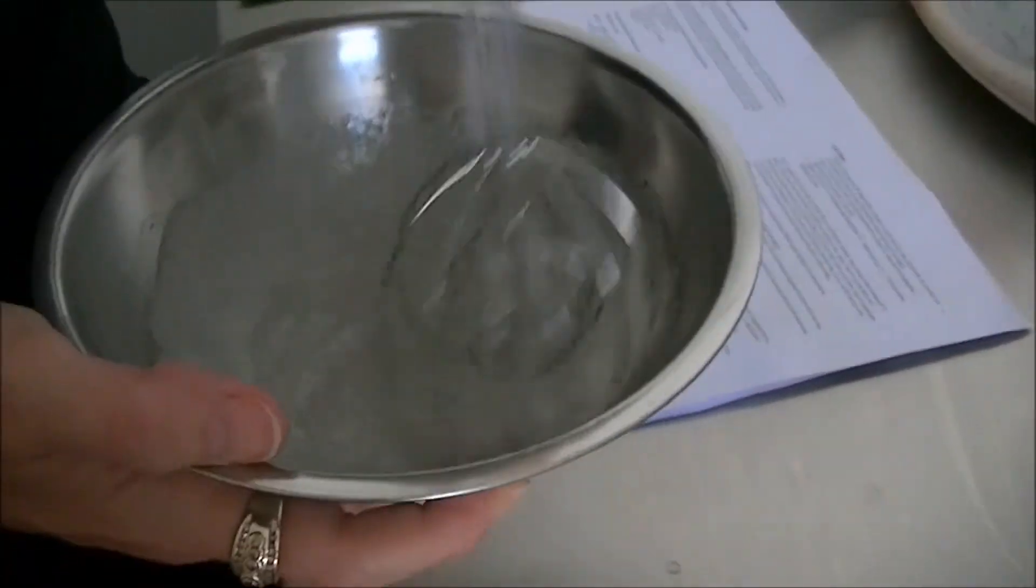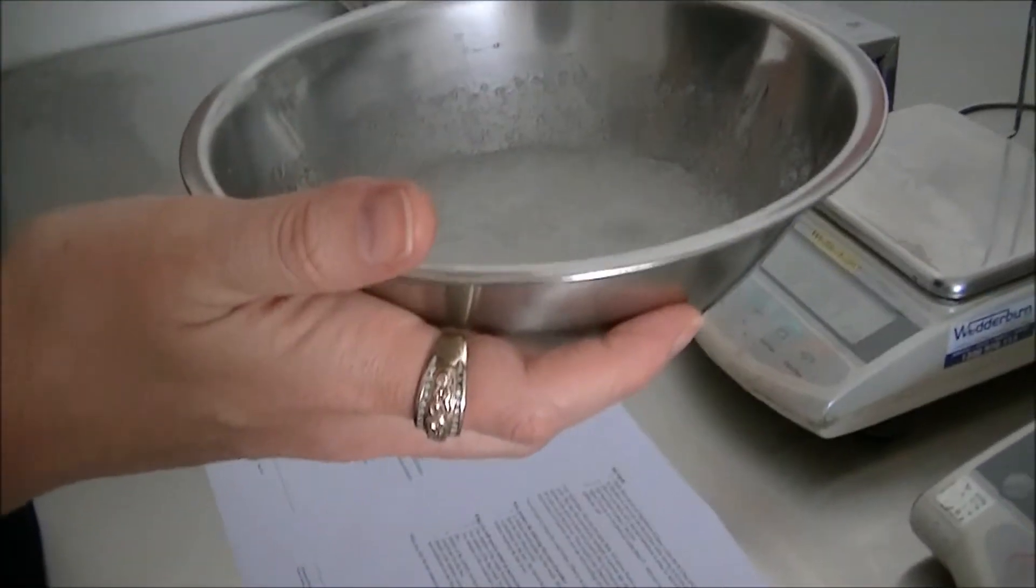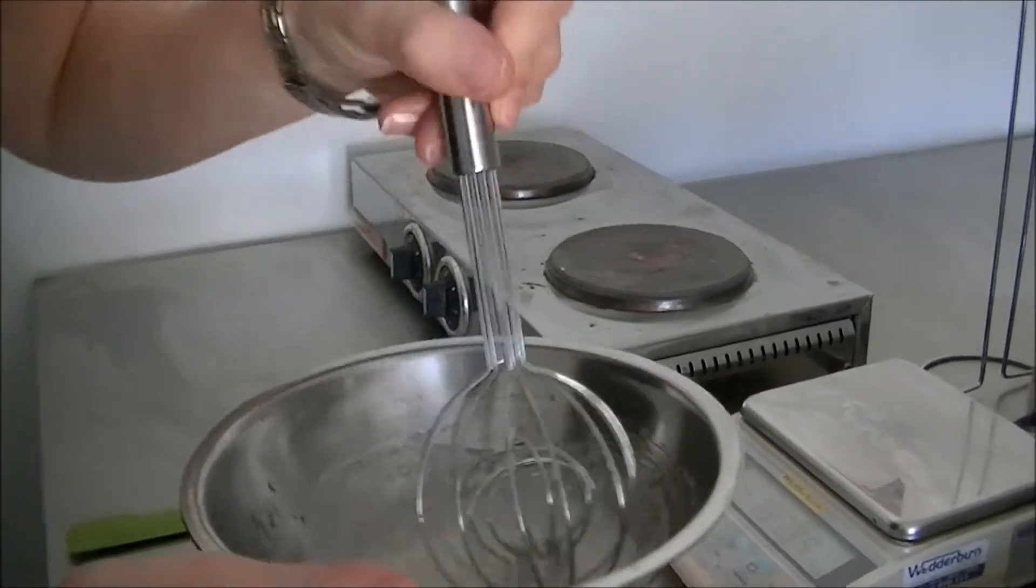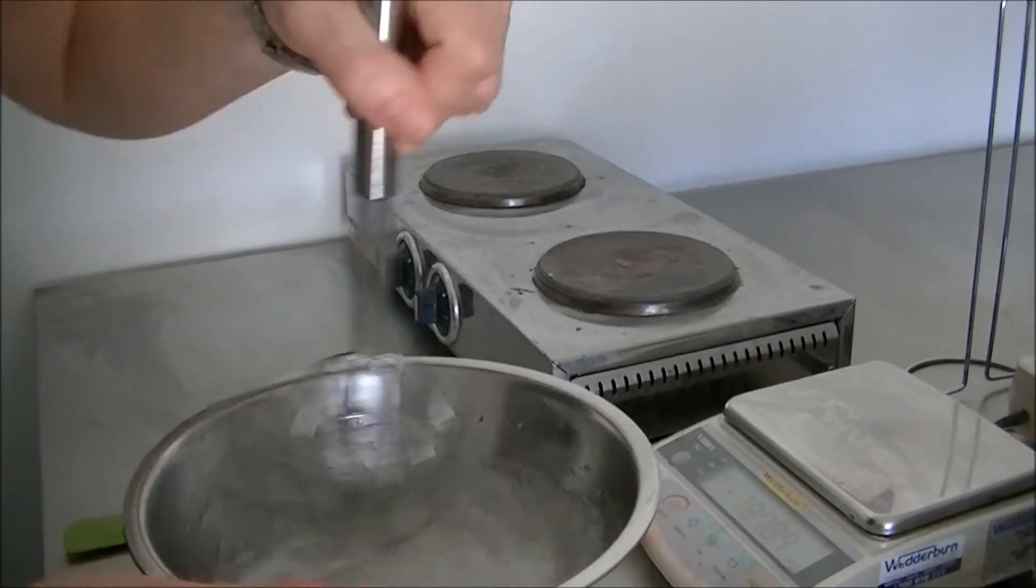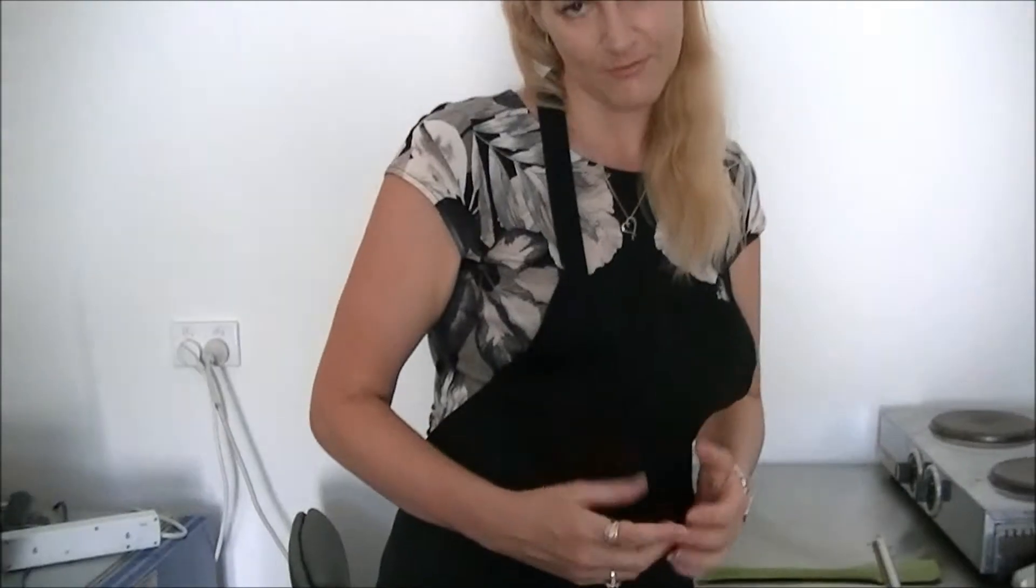Now you can see I have started to form a bit of a gel, but it's still far too runny to be suitable for a consumer. Really really important when you're making your surfactant samples that you do not give up at this point, because altering the pH of your formulas will have a dramatic impact on viscosity.